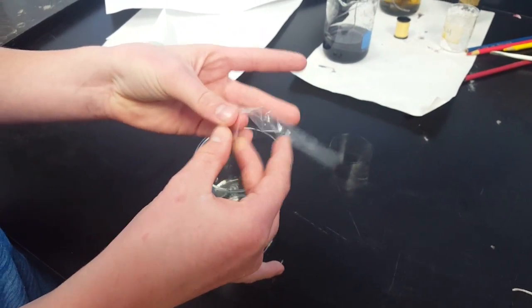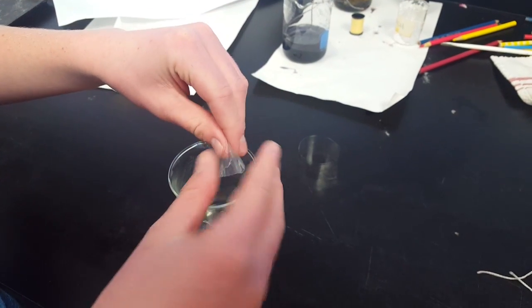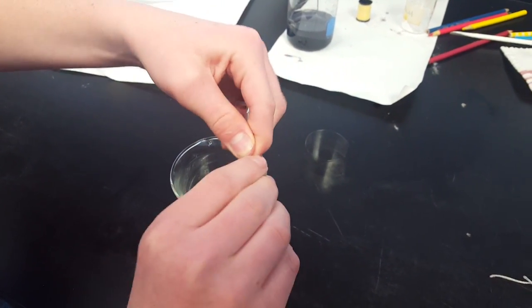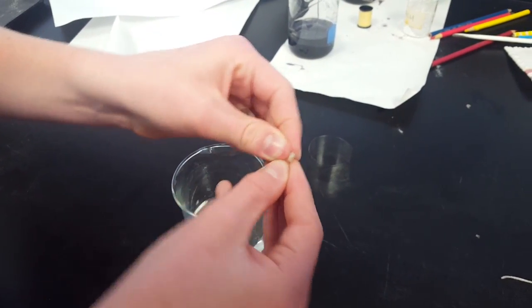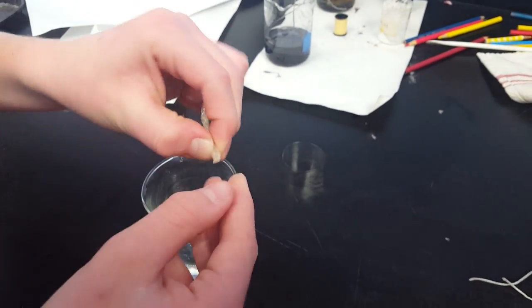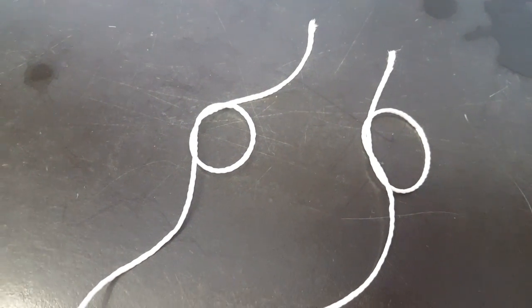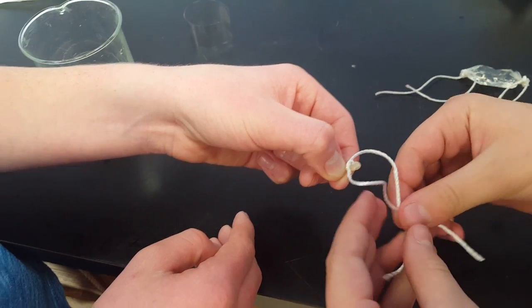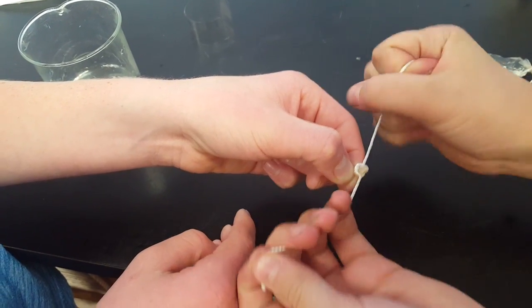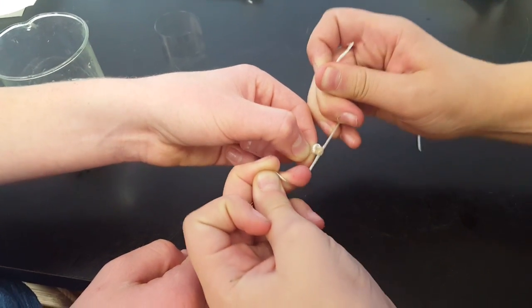The goal now is to tie off both ends of this dialysis tube and to fill it with water. To tie off the ends, my assistant is going to now twist up one of the ends, just like you're twisting a candy wrapper. Then he's going to fold that twisted end in half on top of itself — it just makes a nicer seal when you fold it in half. Be sure to do the fold. My other assistant has prepared two strings with little shoelace-type knots called overhand knots looped through them already. He's going to tie off the ends, adding two or three more overhand knots to really make sure it's sealed tightly. You'll be using thread to do this; we decided to use string just to make it easier to see.